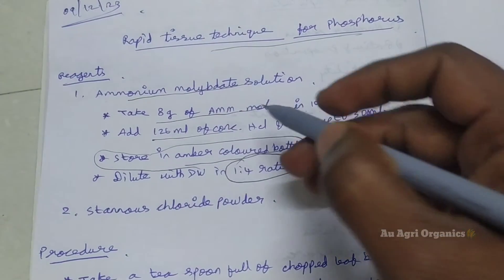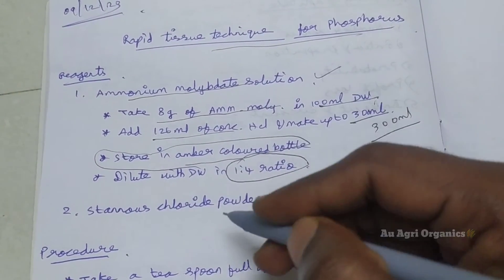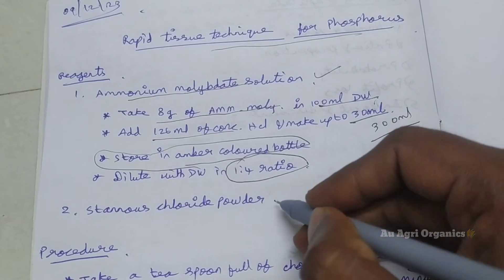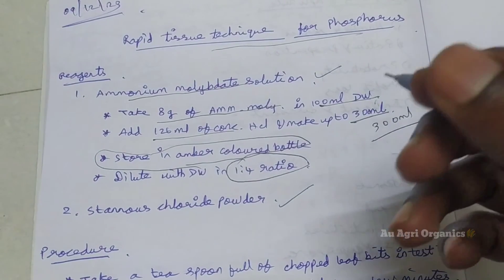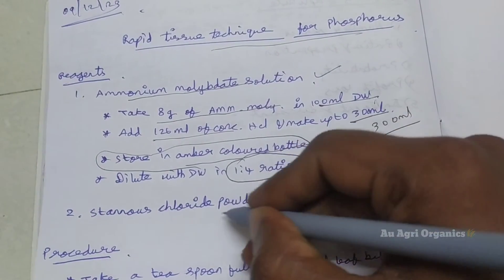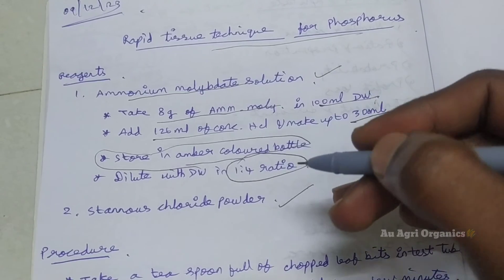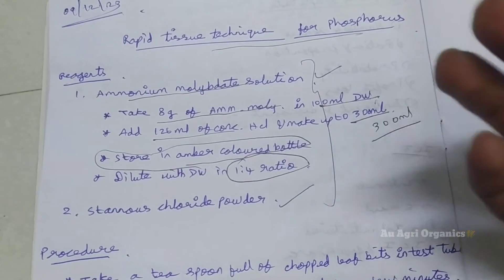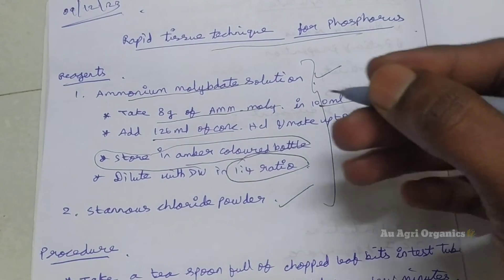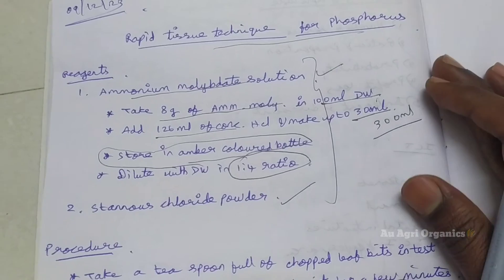This is the solution preparation of ammonium molybdate. Next, we need stannous chloride powder — just the powder is enough, no need to prepare any solution of stannous chloride. So these are the only 2 reagents required for this Rapid Tissue analysis of Phosphorus.